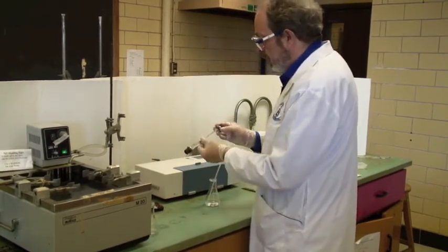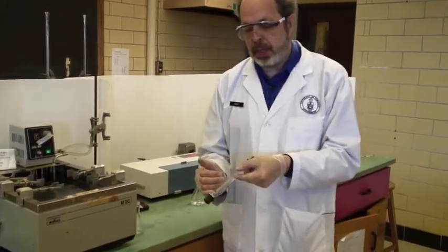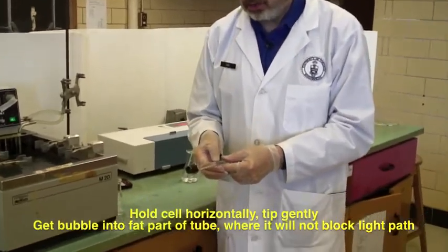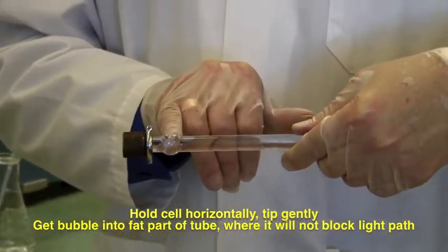Okay. Now there probably will be a bubble. But you notice there's a fat part in the tube here. And the trick is to hold it horizontally so the bubble is held in the fat part.